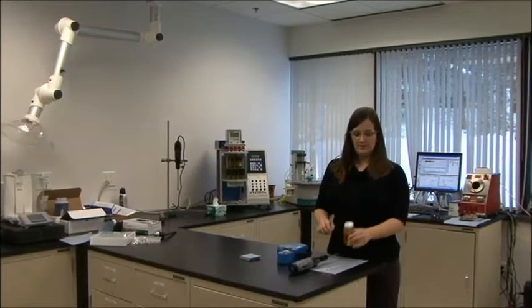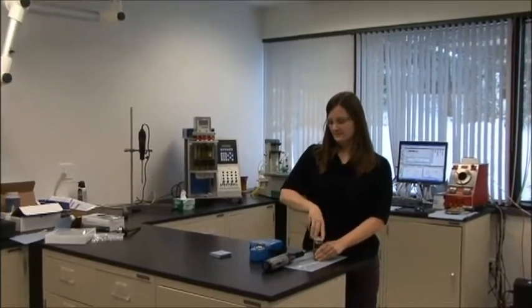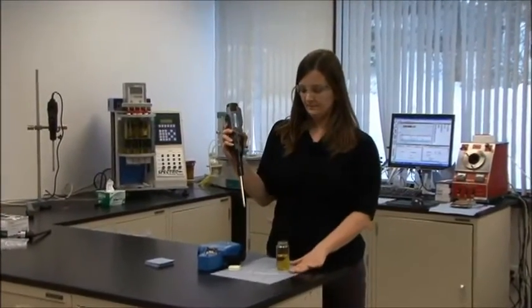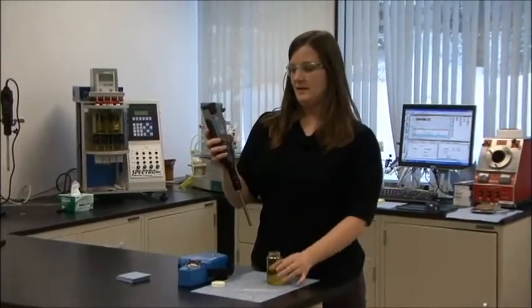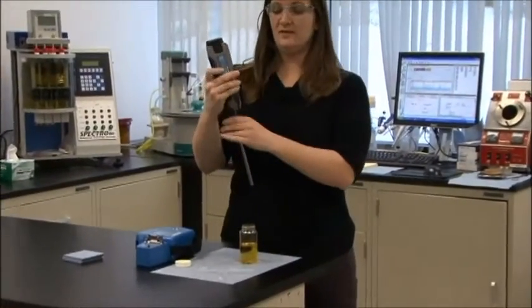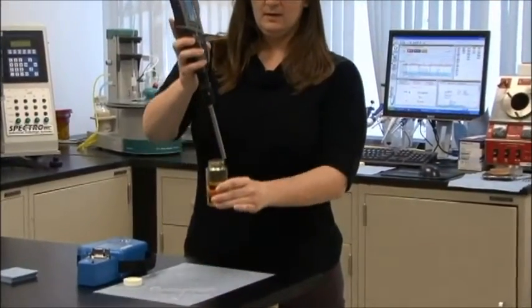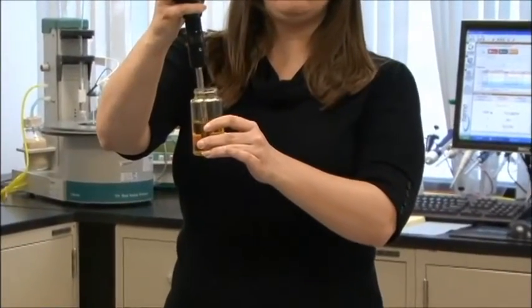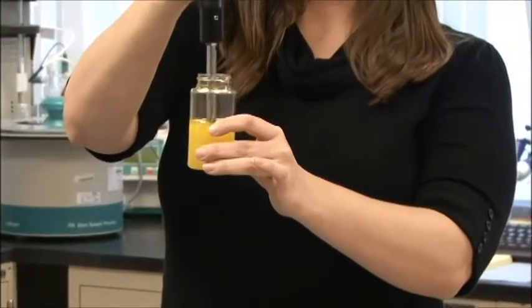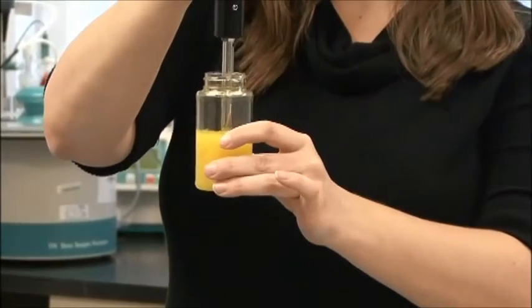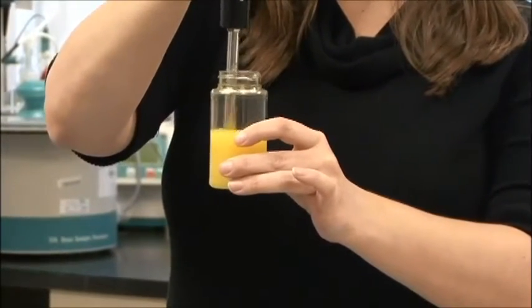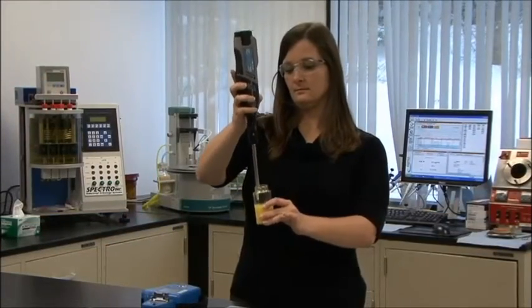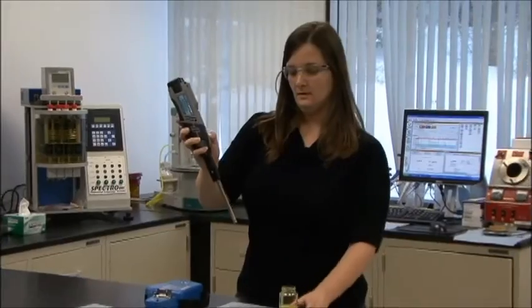I have my oil sample and I have a homogenizer. So in order to prepare my sample, I need to put my homogenizer on high, insert it into my sample bottle, and homogenize for about 30 seconds.